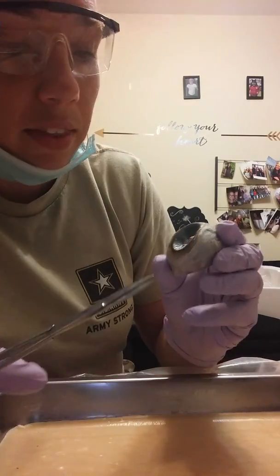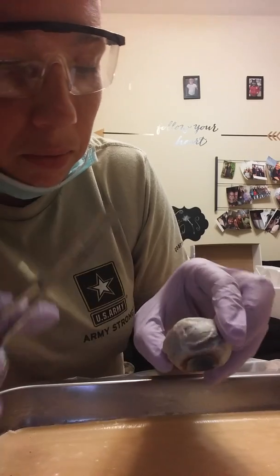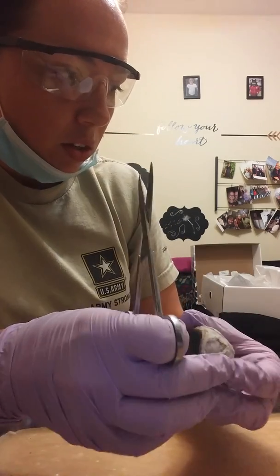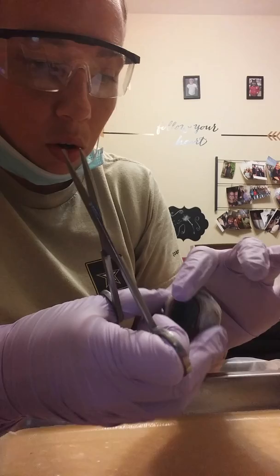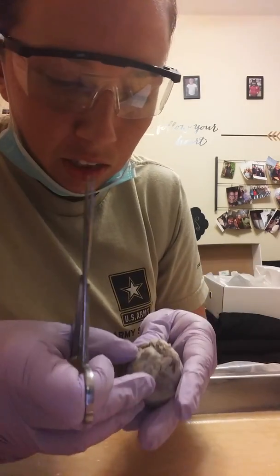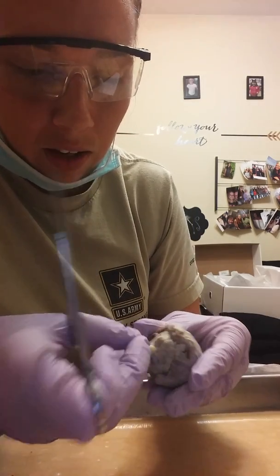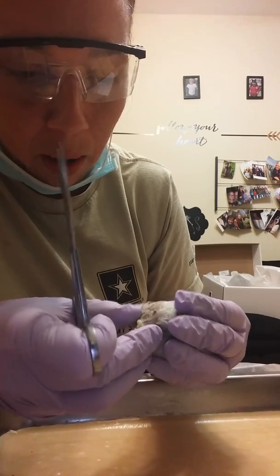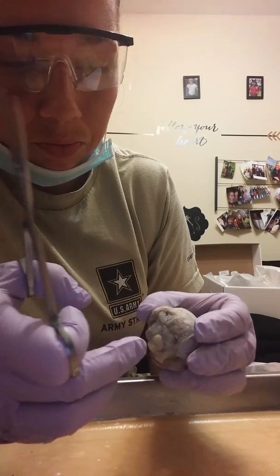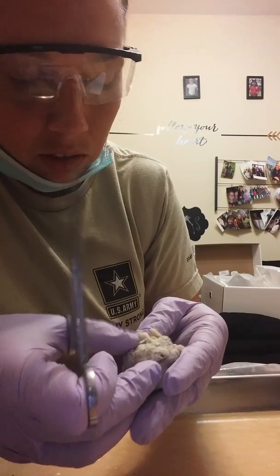Alright, so just looking at the eye, this outer cloudy structure right here is going to be the cornea. And then the thick outer white wall surrounding the eyeball is the sclera. In the back, this is actually really hard to see, but the optic nerve would normally be hanging off right here. We've got some fat, but the optic nerve comes out of the back of the eyeball and attaches to the brain. Yeah, it's really hard to see that actually.